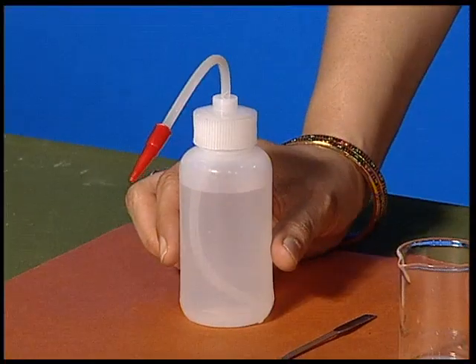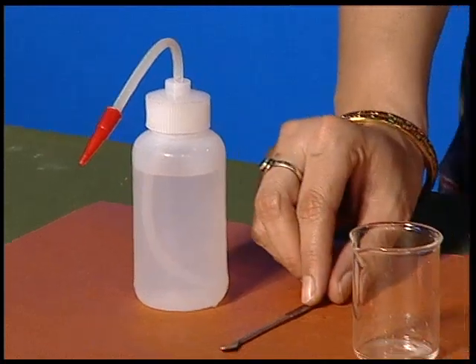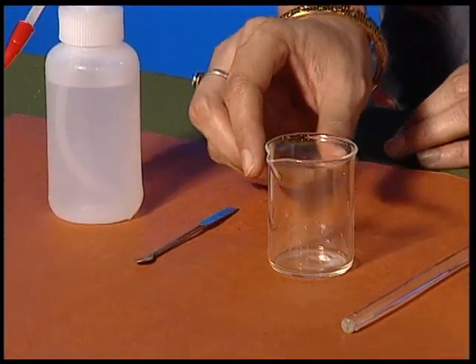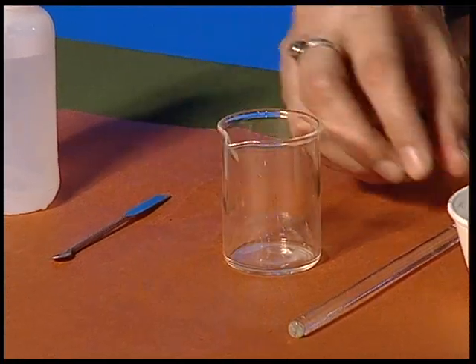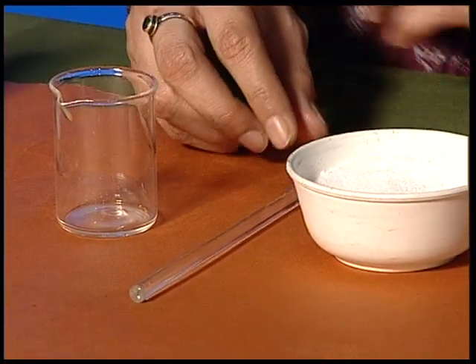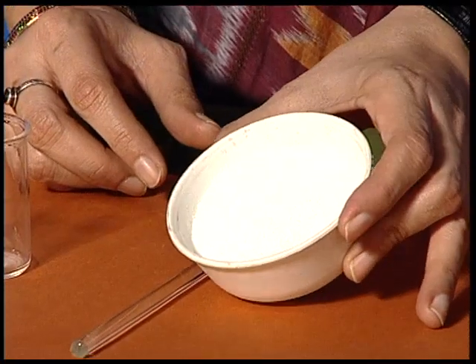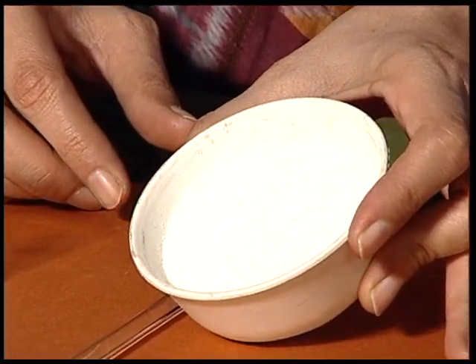For this, we need water, a spatula, an empty beaker, a glass rod stirrer, and the substance that we have taken here is common salt.